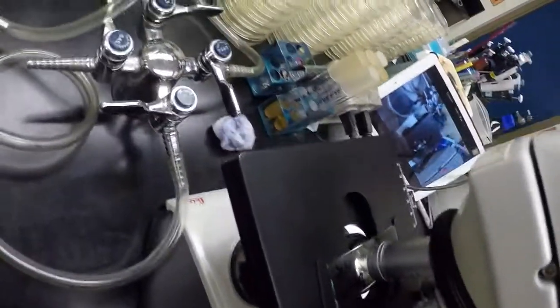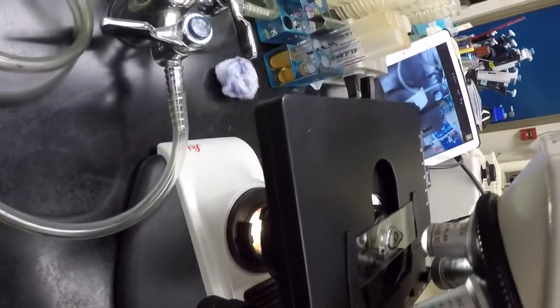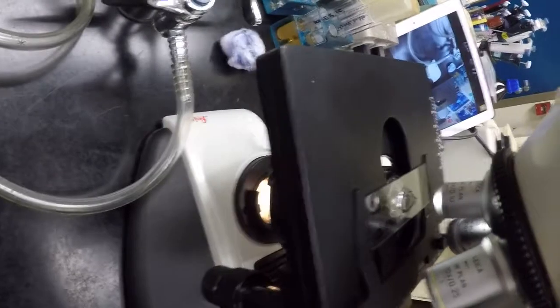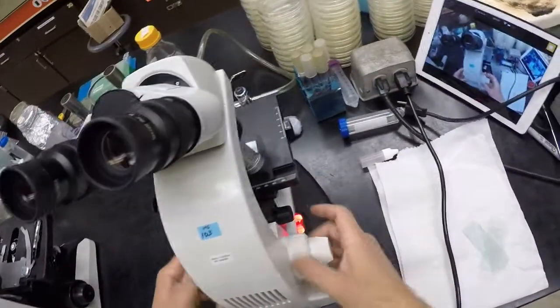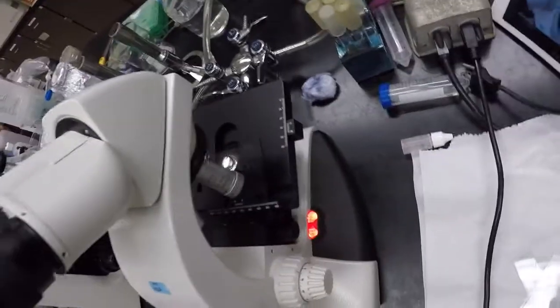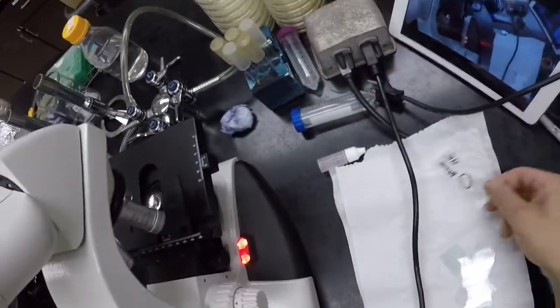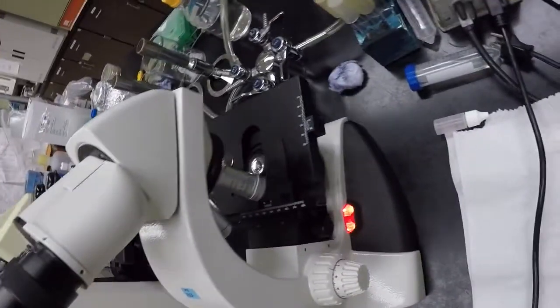Okay, so I'm now officially done. What I'm going to do is rotate back to the 4 times lens, my safe lens, right? So that's my safe lens, and then get it back to safe position. All the way down, so we have maximum clearance between the 2. Okay, and then slide out the slide. This goes straight into the discard that'll be on the cart, and then we're going to clean our lens.